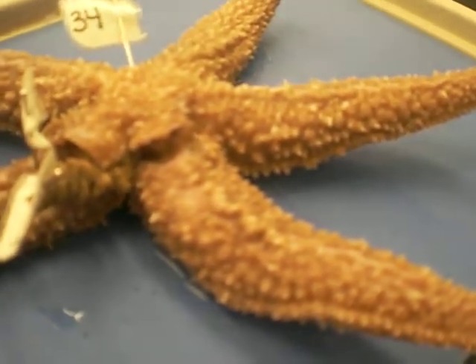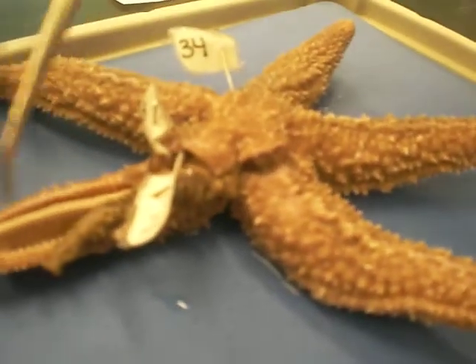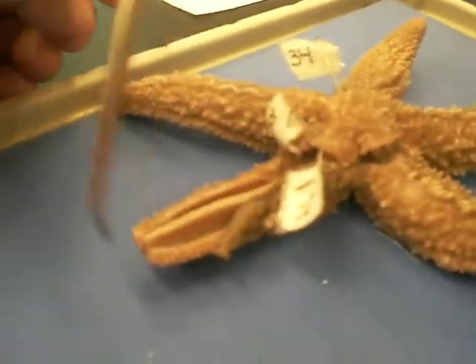That's pretty much it. Let's check under so we can see the Ambulacral Groove. I can see the Ambulacral Groove right here.